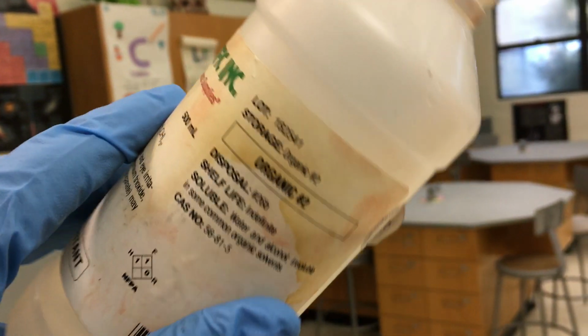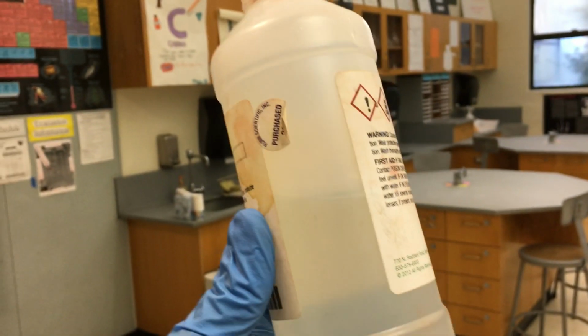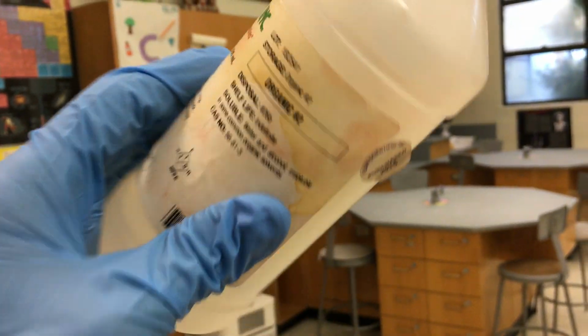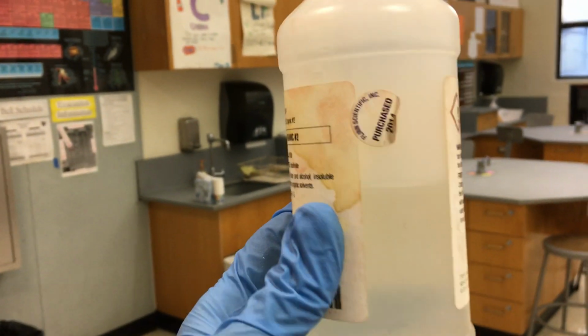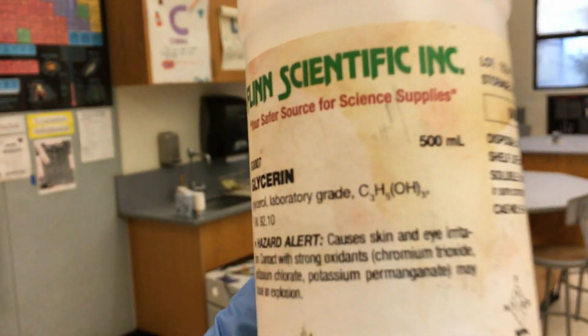The ability of a liquid to flow, the more scientific term for that is viscosity. It's more viscous than water. It looks something closer to olive oil. Not as viscous as something like honey or molasses, but still pretty viscous. So it's a clear liquid at room temperature, and that is our chemical formula.